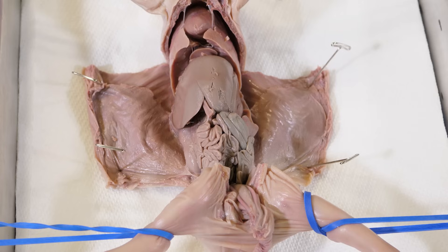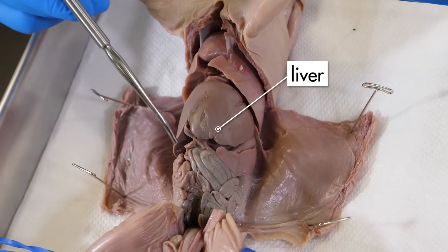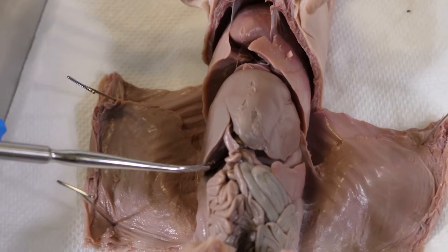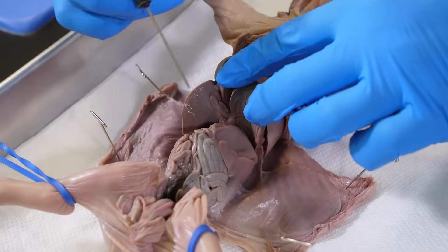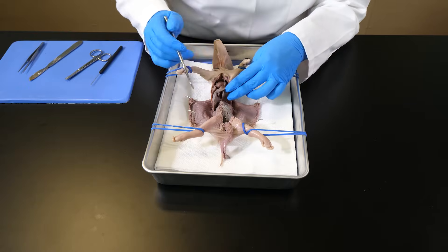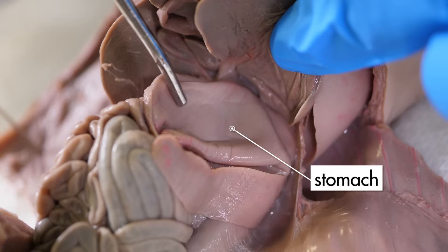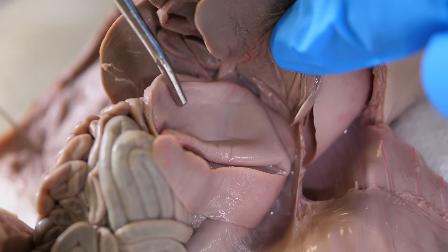Now we can examine the organs of the digestive system. The largest organ in the body cavity is the liver. A pig's liver has five lobes, three of which can be seen here. Beneath the liver is the gallbladder. When we lift up the left lobes of the liver, we see the stomach. A pig has a one-chambered stomach, which performs both mechanical digestion and chemical digestion. Since a fetal pig has never used its stomach, the stomach is rather flat.